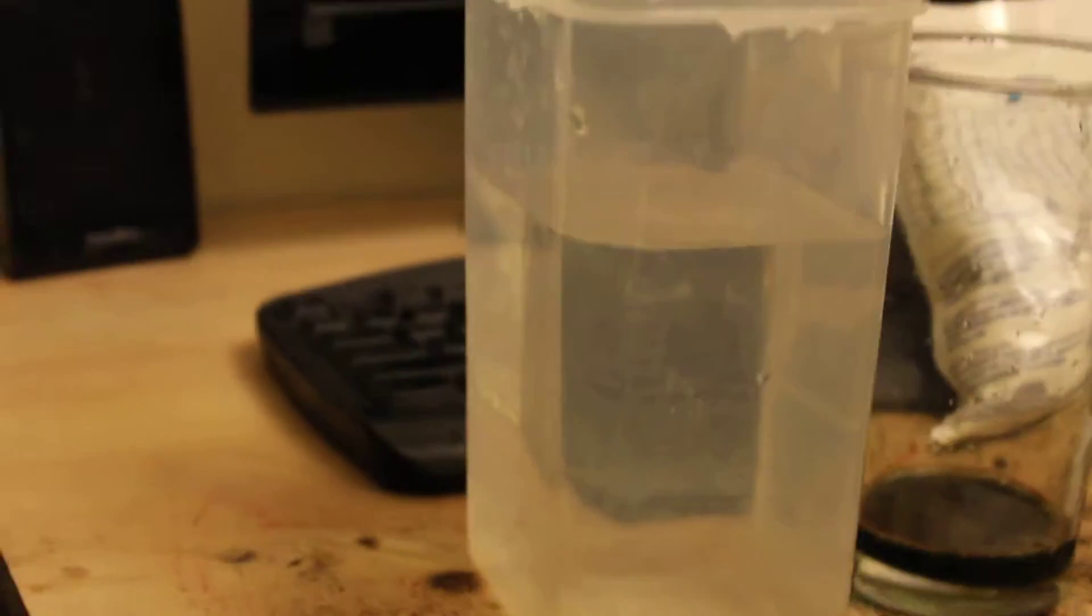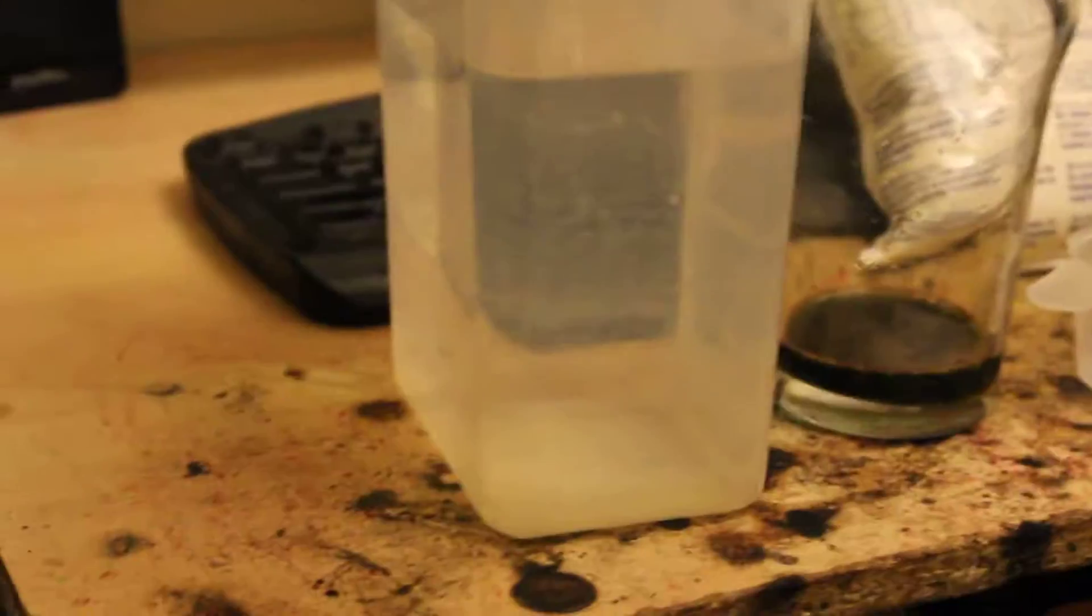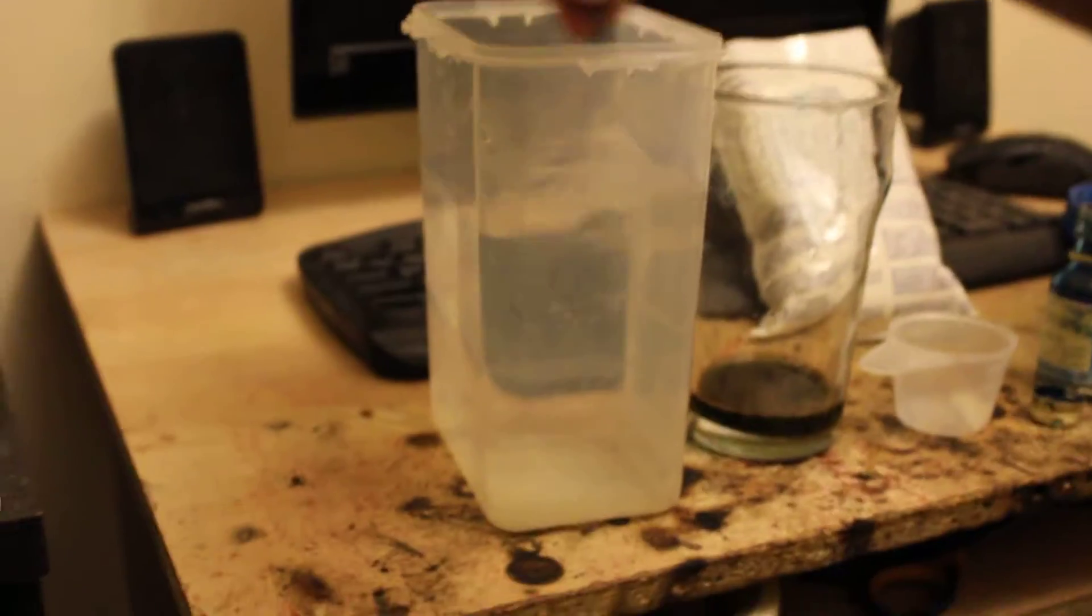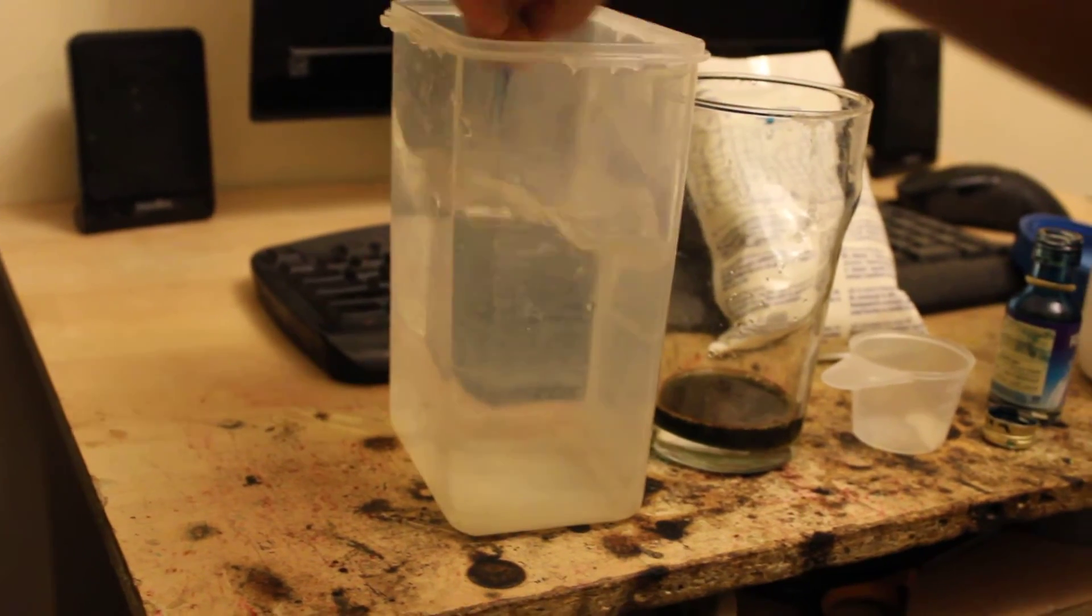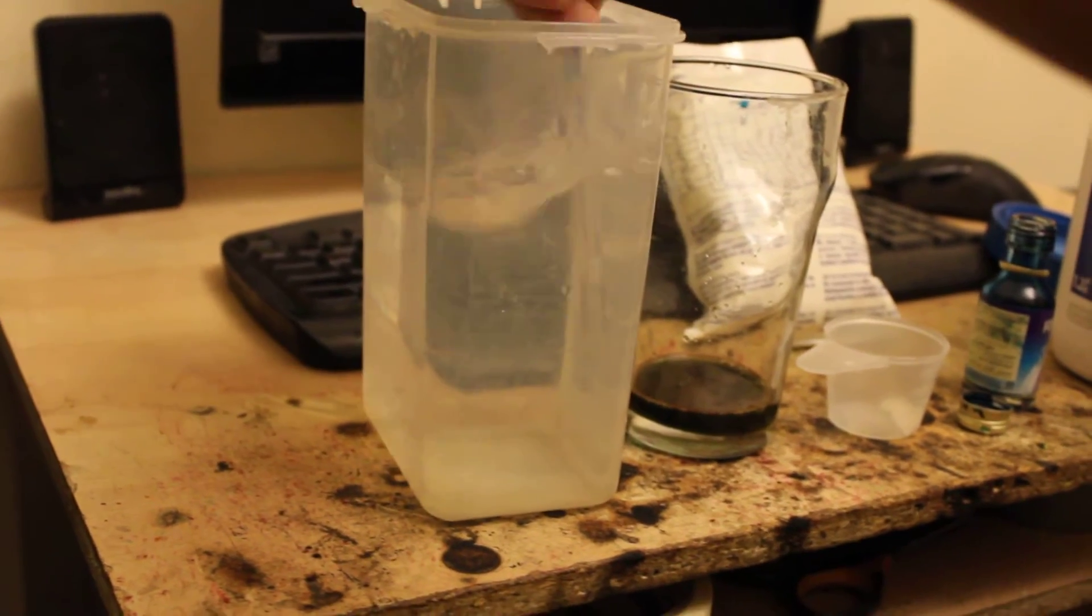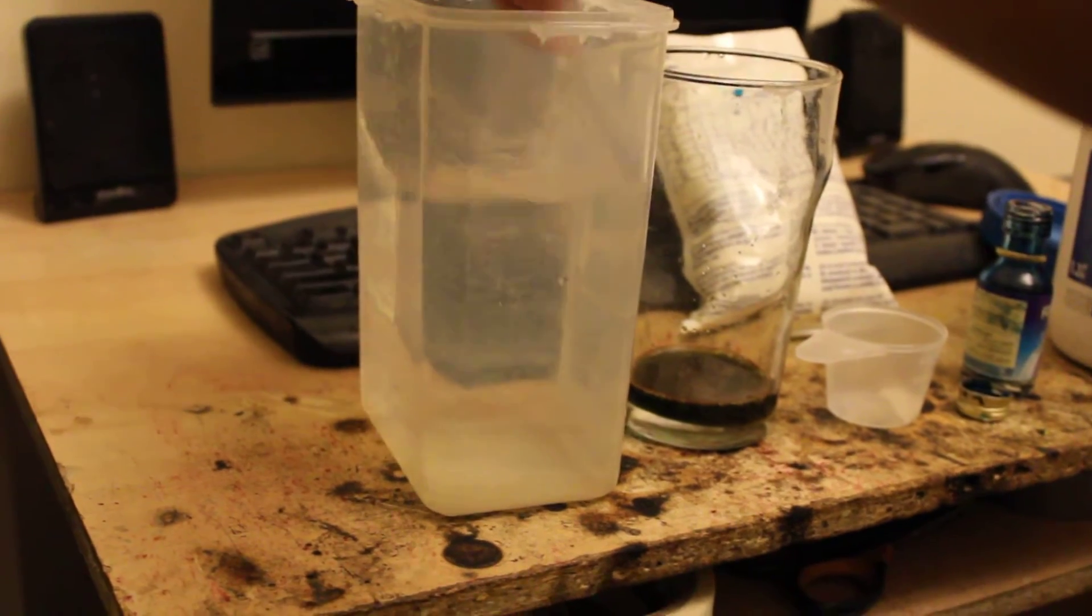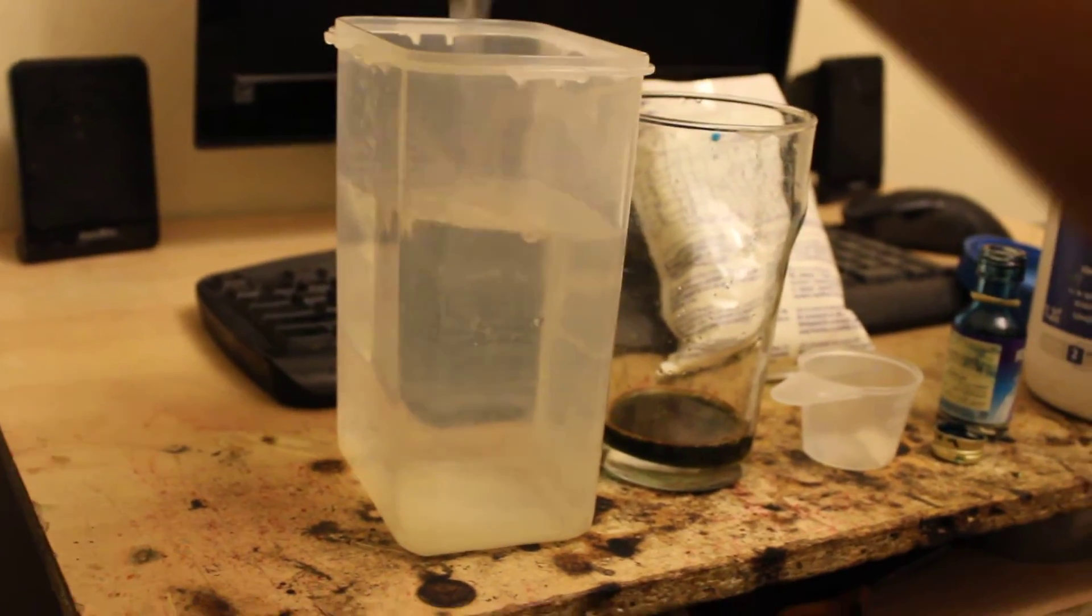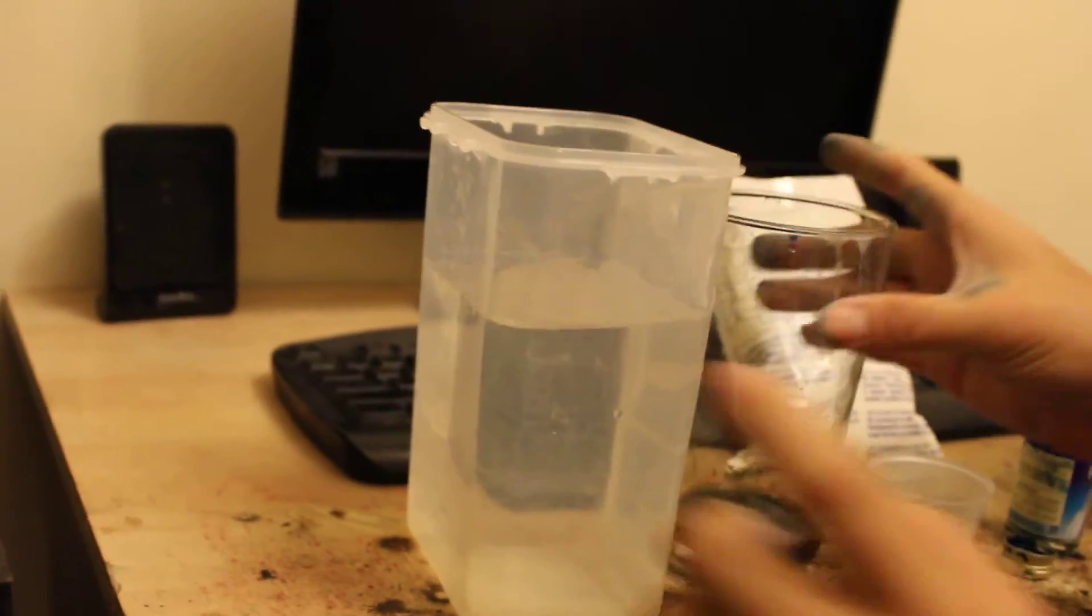Now I need something to mix it. I'm gonna quickly look for something. I got a pen. So what you do is I just mix this. It just contains another experiment, so it should be nothing. And you can test this yourself to check in case you think I did something wrong.